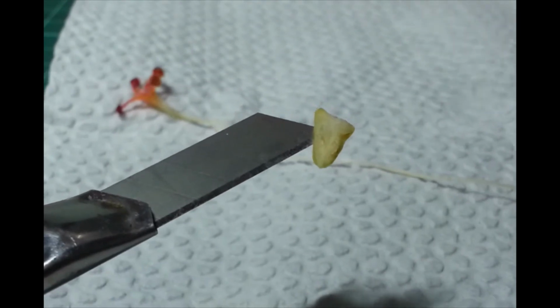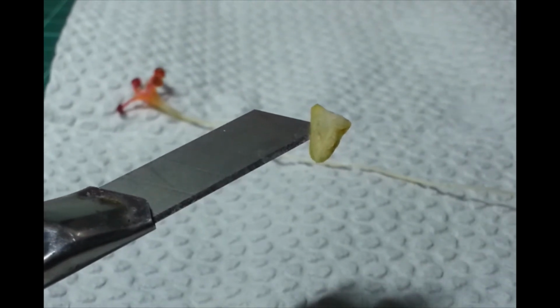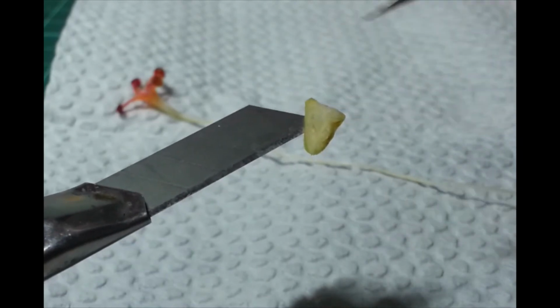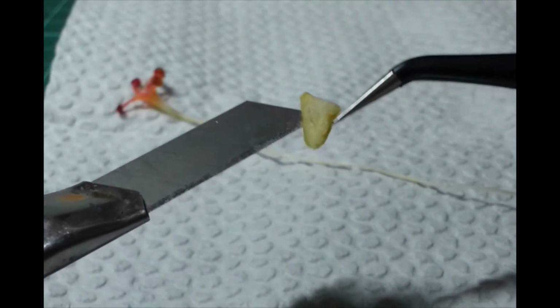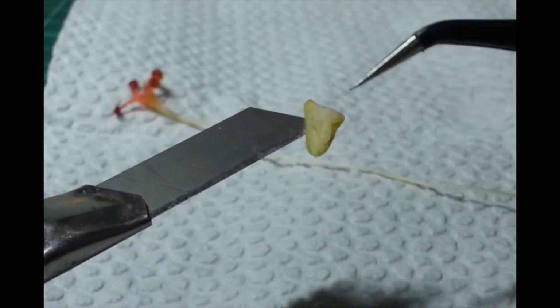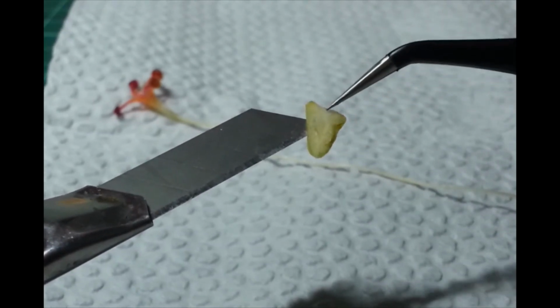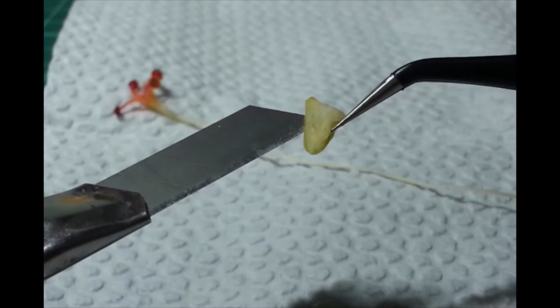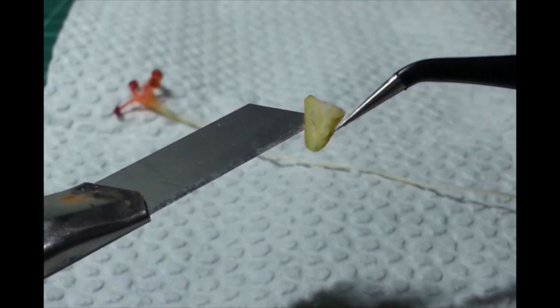Okay, so I've put this white background here so it's easier to see. And I secured it with a cutter para hindi gumalaw. So, this is the ovary. Okay. You can see that at the center there, may mga naka-attach na bilog-bilog. Kita nyo ba? So, this is an individual ovule.